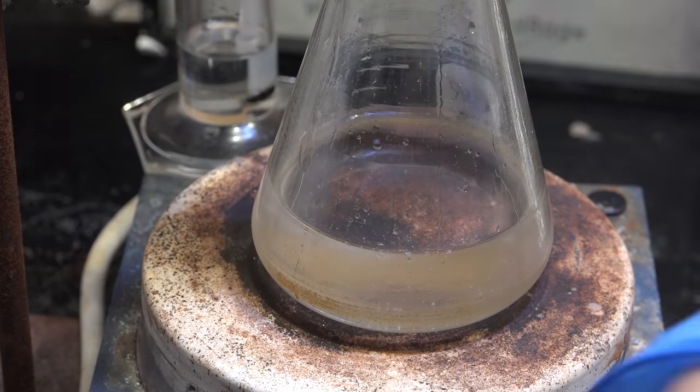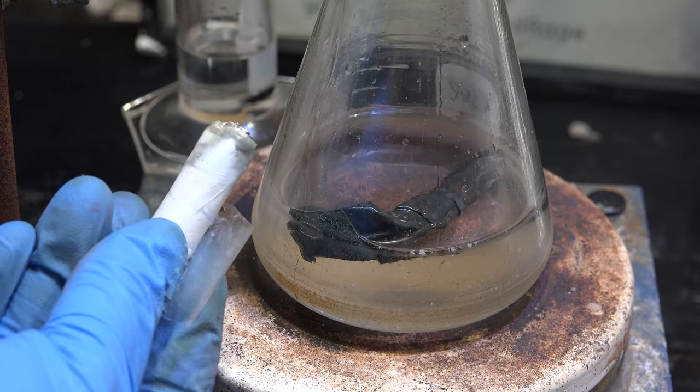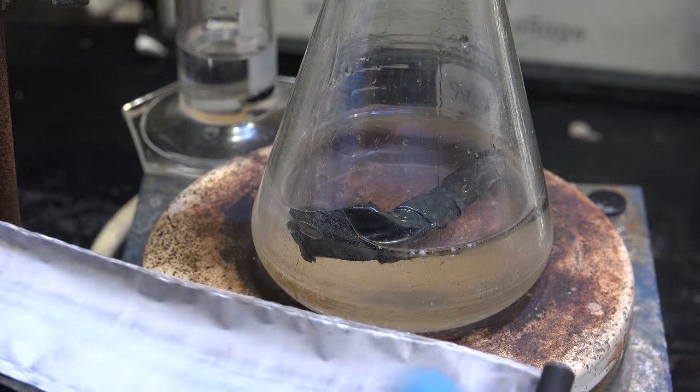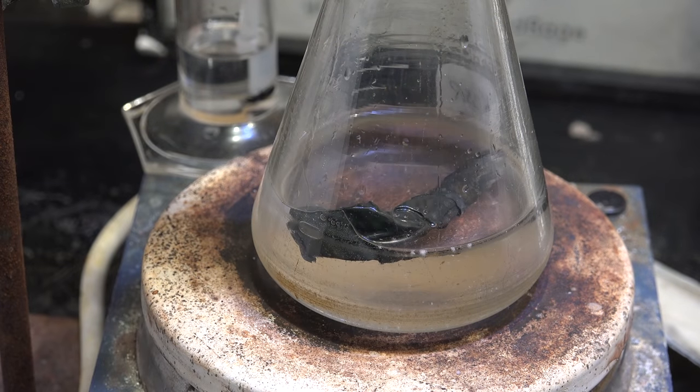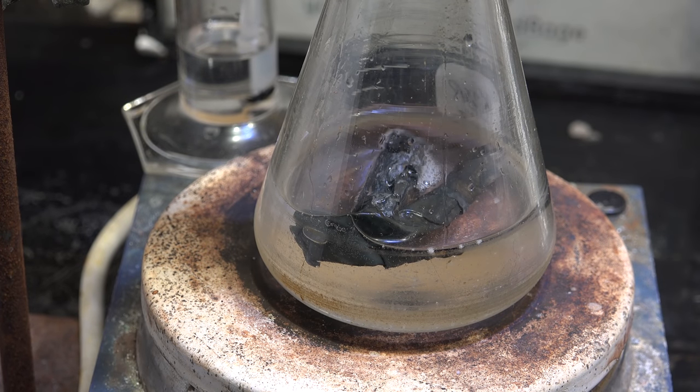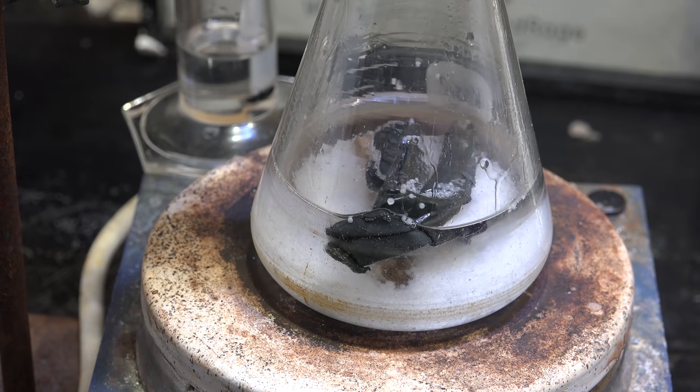So making sodium from lithium is back on the table. Now I already have a nine year old video on getting lithium from energizer batteries that I've linked in the video description. So I won't get into it here. I'm going to use two energizer batteries worth of lithium. And there we go, now for our sodium hydroxide as well as our tertiary alcohol.